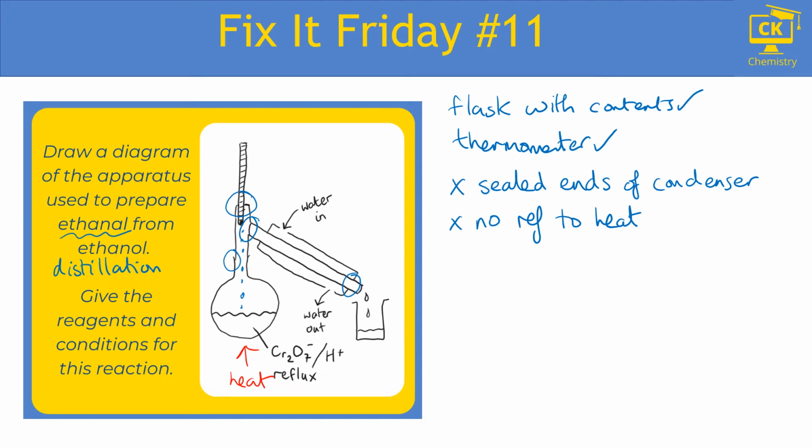Okay, now let's have a look at our condenser. Another common problem, so they realise that they have to label the water in and water out, but they are the wrong way round. So water goes in at the lowest point of the condenser. So in this case, that is the point on the right hand side. So we want the water to flow against gravity so that we can maintain a good pressure in the condenser, keep the cold water flowing around, and therefore keep condensing the liquid really well. And so our water should be in at the bottom of the condenser, not at the top.